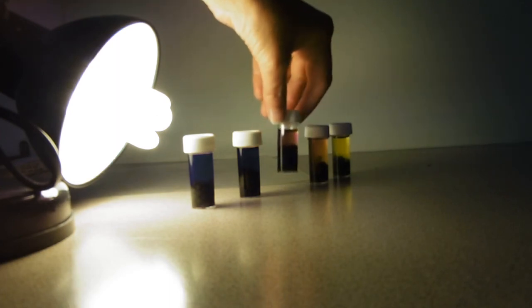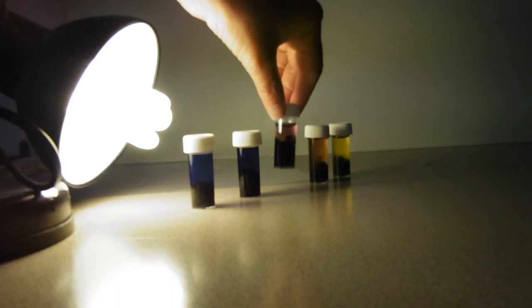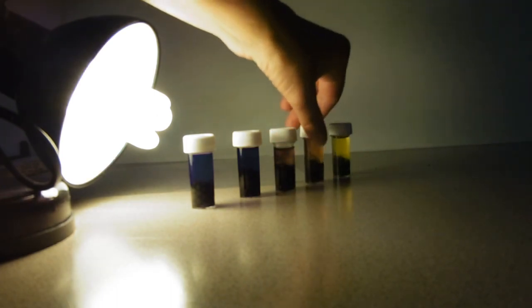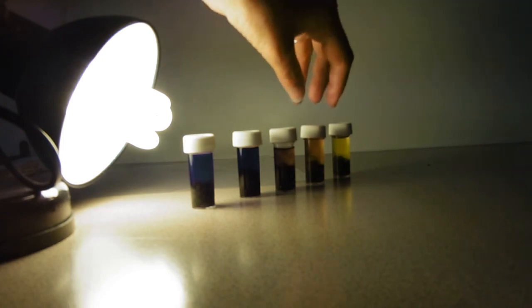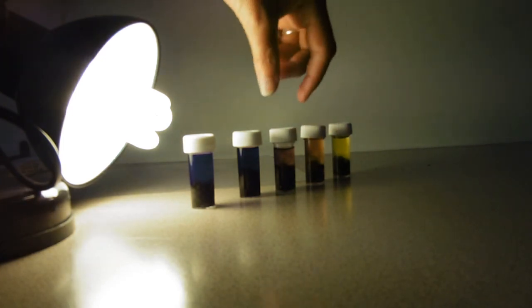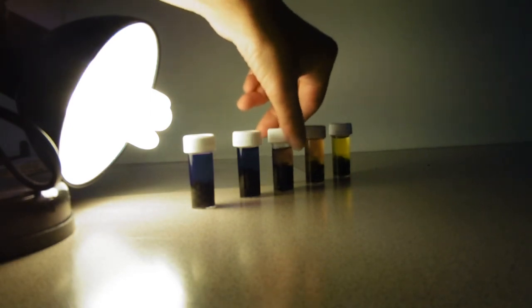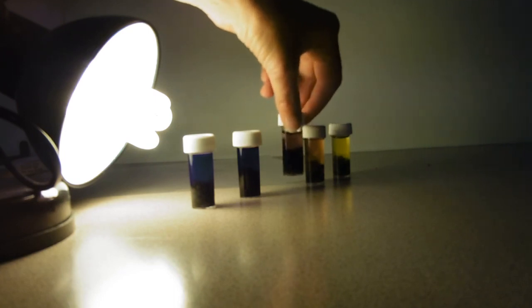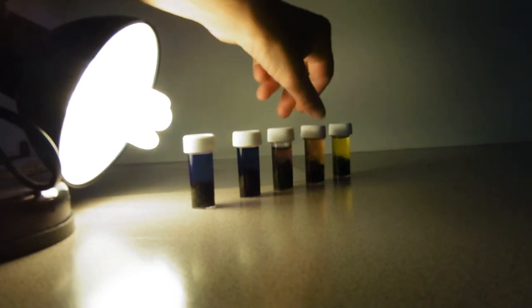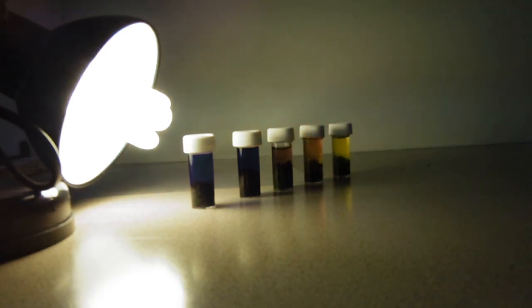You need to separate out the beads — use a tea strainer to separate out the beads, or decant or use a dropper to extract the solution. It's a good idea to give them a bit of a swirl first, because you can see that purple is really coming out of the beads. It tends to accumulate around the beads because that's where the reactions are happening.